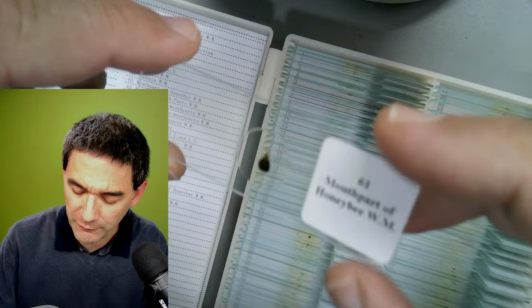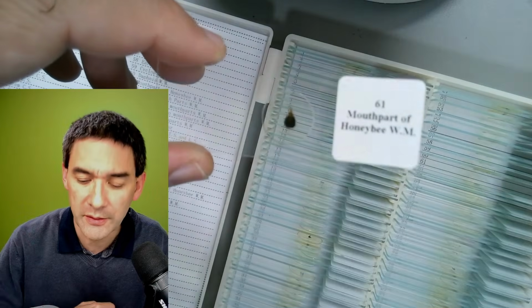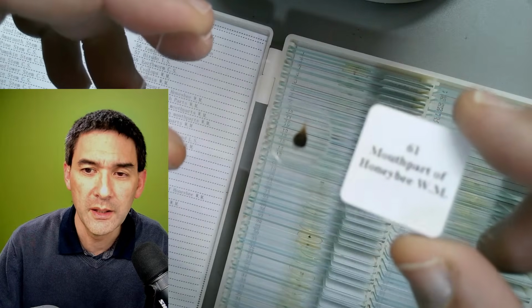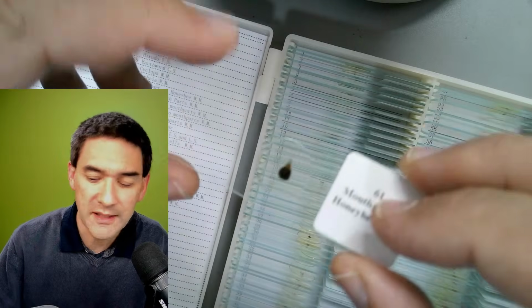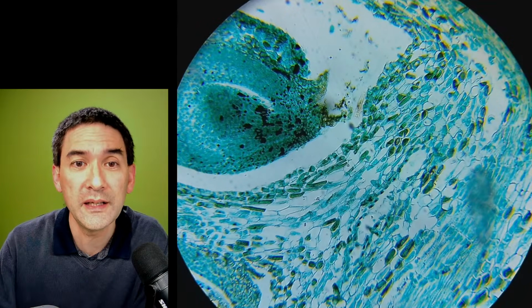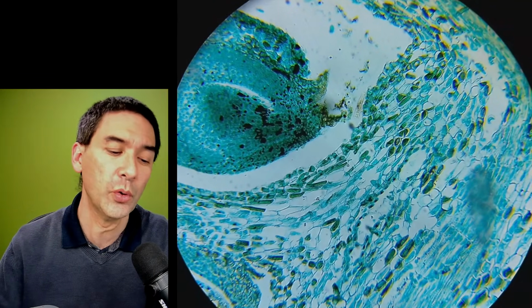And the thing is the following, that some specimens, like for example those insect specimens here, have very dark and very bright areas, and this basically means that we have a dynamic range issue, and so that's why I like to check this a little bit, whether the camera is also able to capture the dynamic range. Having said that, there is one advantage that those mobile phone cameras have, and that is you're getting a very wide field of view. So that's one advantage, and the other advantage is you can actually record a video.